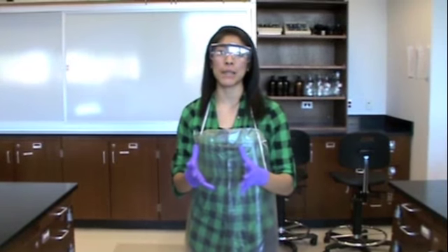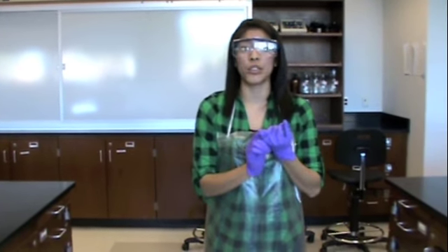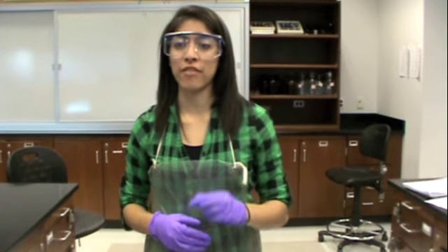Welcome to Chemistry Lab. Today I will be helping you and giving you some tips about Lab 504, which deals with titration. So first recommendation is to be very patient, because if you are not patient, you can get inaccurate results. The purpose of this experiment is to find the concentration of acetic acid in the form of mass percent, which is usually about 5%.